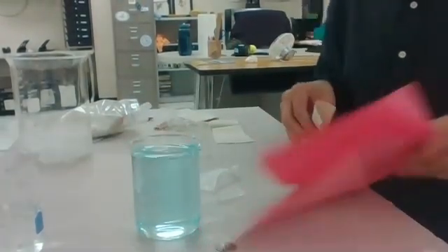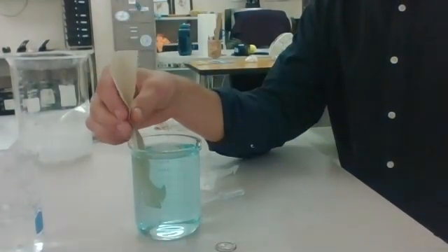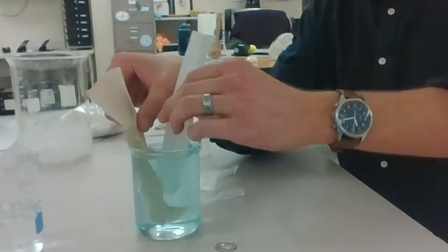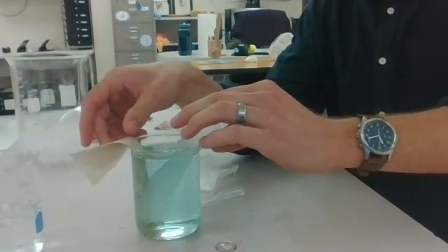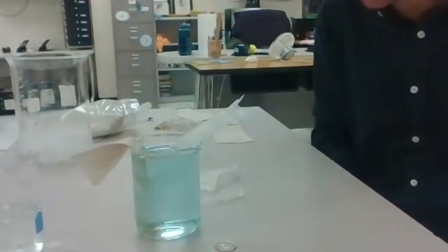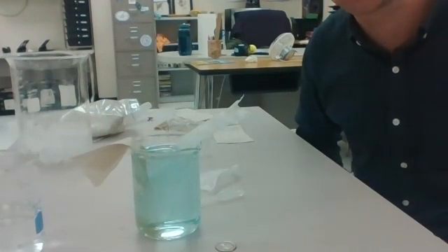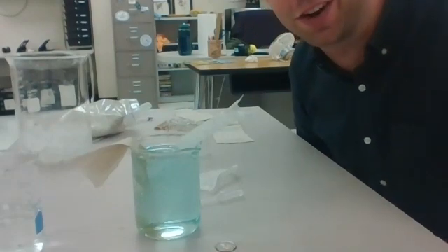Okay, so I got my water, I've got my paper towel, I've got my wax paper. I tell you what, why don't we let this go for like a full 2 minutes? You don't have to sit here and wait for 2 minutes, so I'll pause the video and restart in 2 minutes.